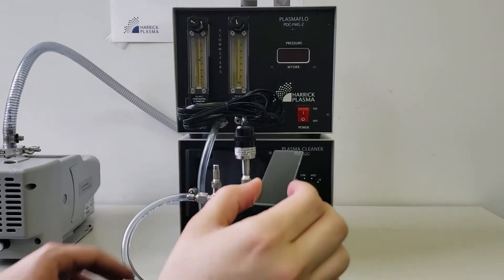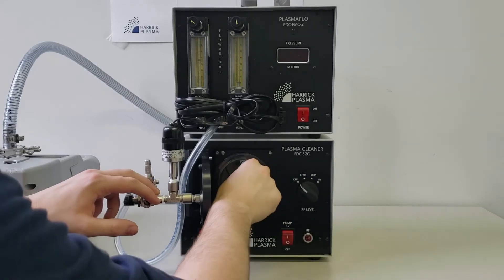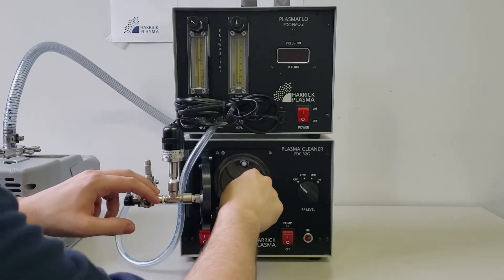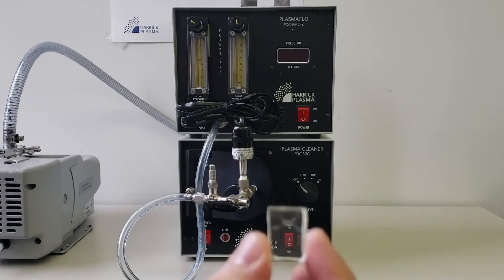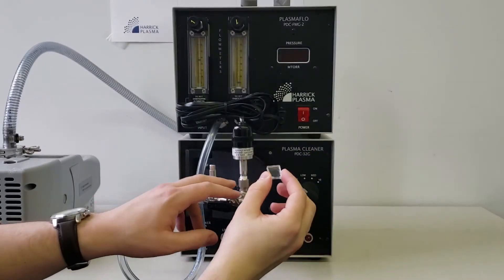Place the glass slide in the chamber. Place the PDMS component in the chamber.